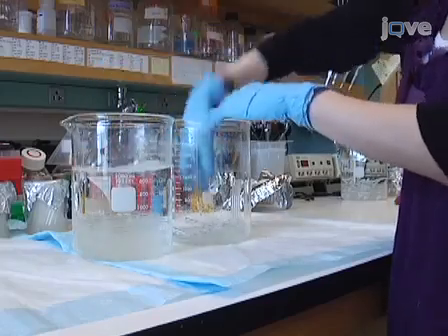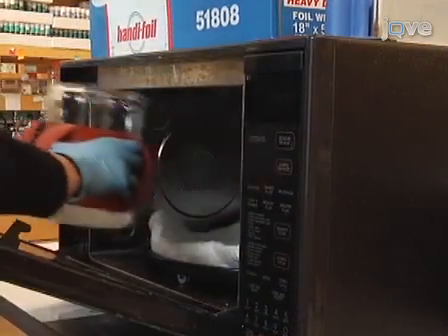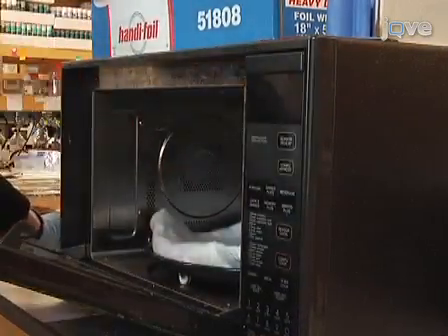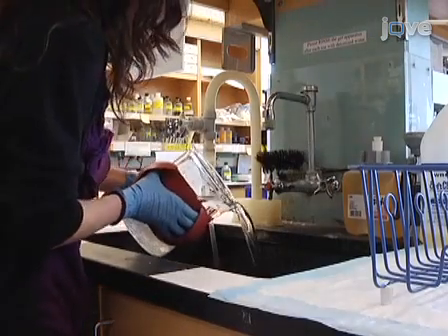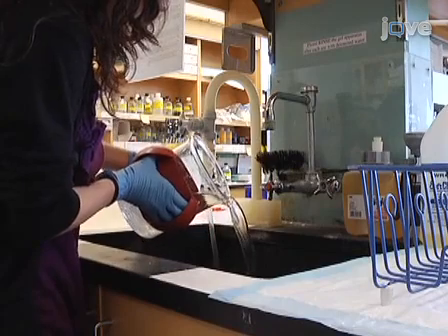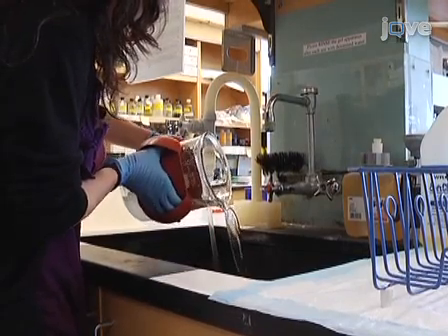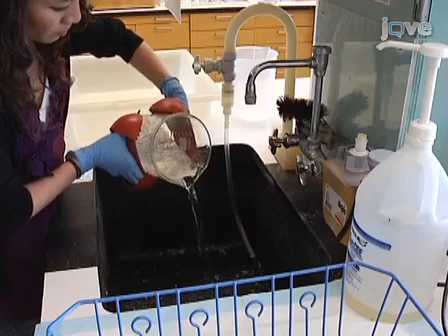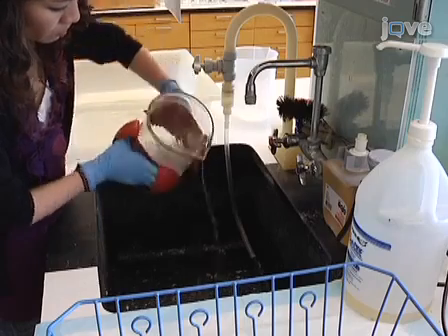Transfer the activity tubes to a new beaker with fresh tap water and repeat the microwaving and wax removing process. Since most of the wax has been removed in the previous step, it is not necessary to wait for the wax to solidify. Simply pour the water out of the beaker and transfer the tubes into a new beaker. Use caution since the water is still hot.